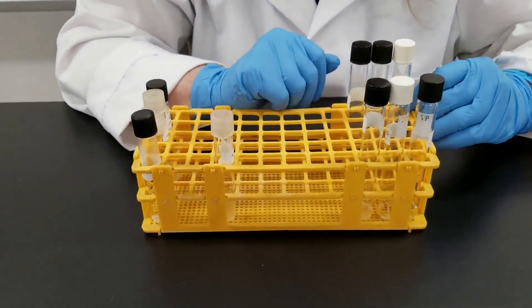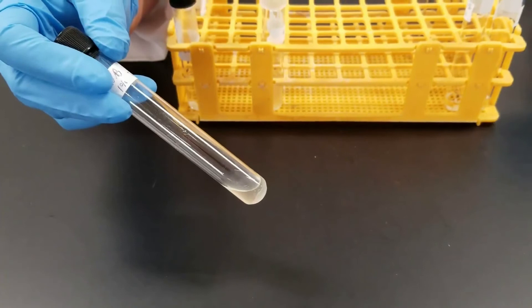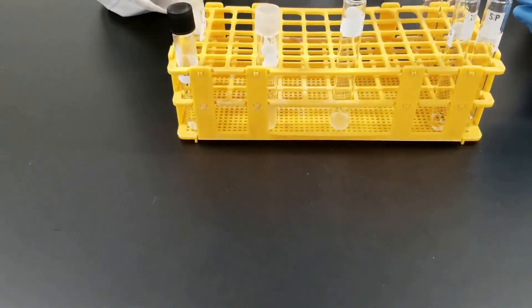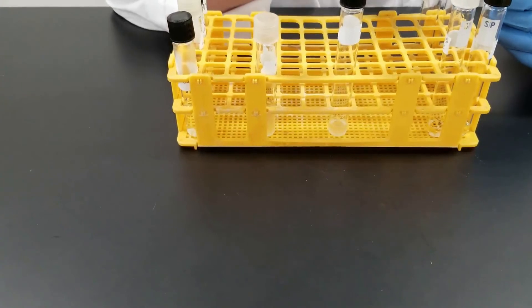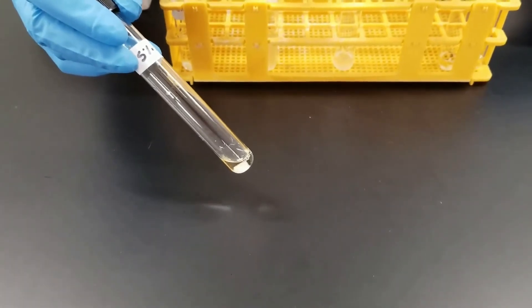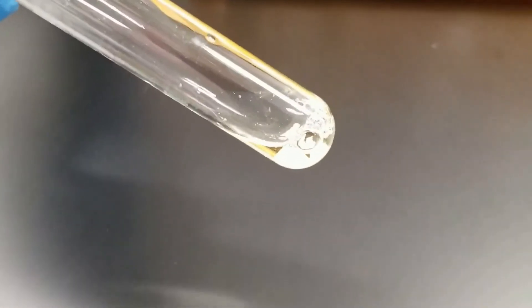The other preservative we looked at was the various salt concentrations. At 1% salt, Staphylococcus shows nice growth — it's known to have a high tolerance for salt. And Enterobacter at 1% also had some growth. At the next concentration, 5% sodium chloride, Enterobacter — you can see how clear that liquid is, there is no growth, so 5% salt is inhibitory to it. For the Staphylococcus at 5%, there is a little bit of cloudiness — not very much — it's just starting to grow a little bit, so it did slightly better than the Enterobacter.